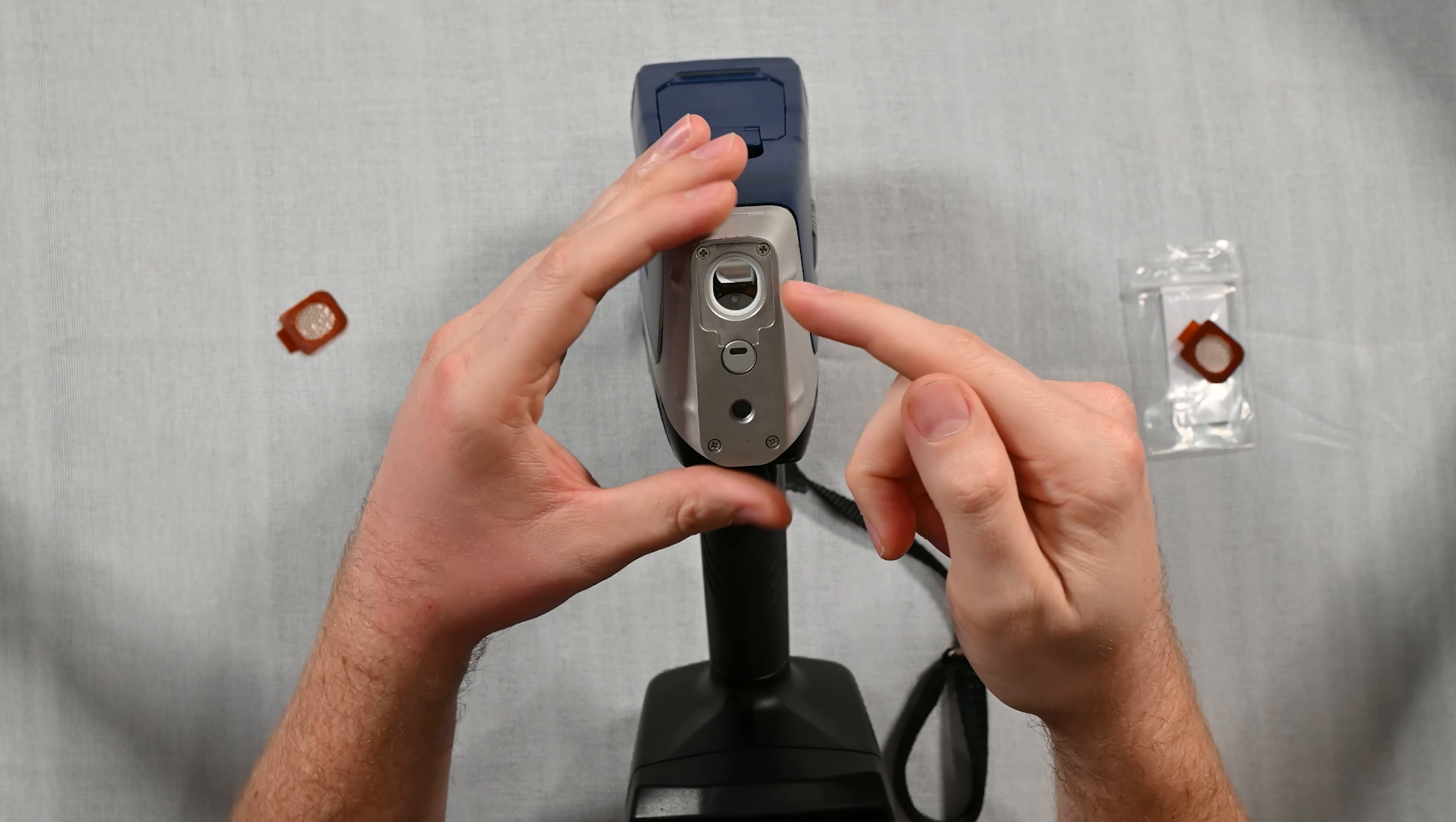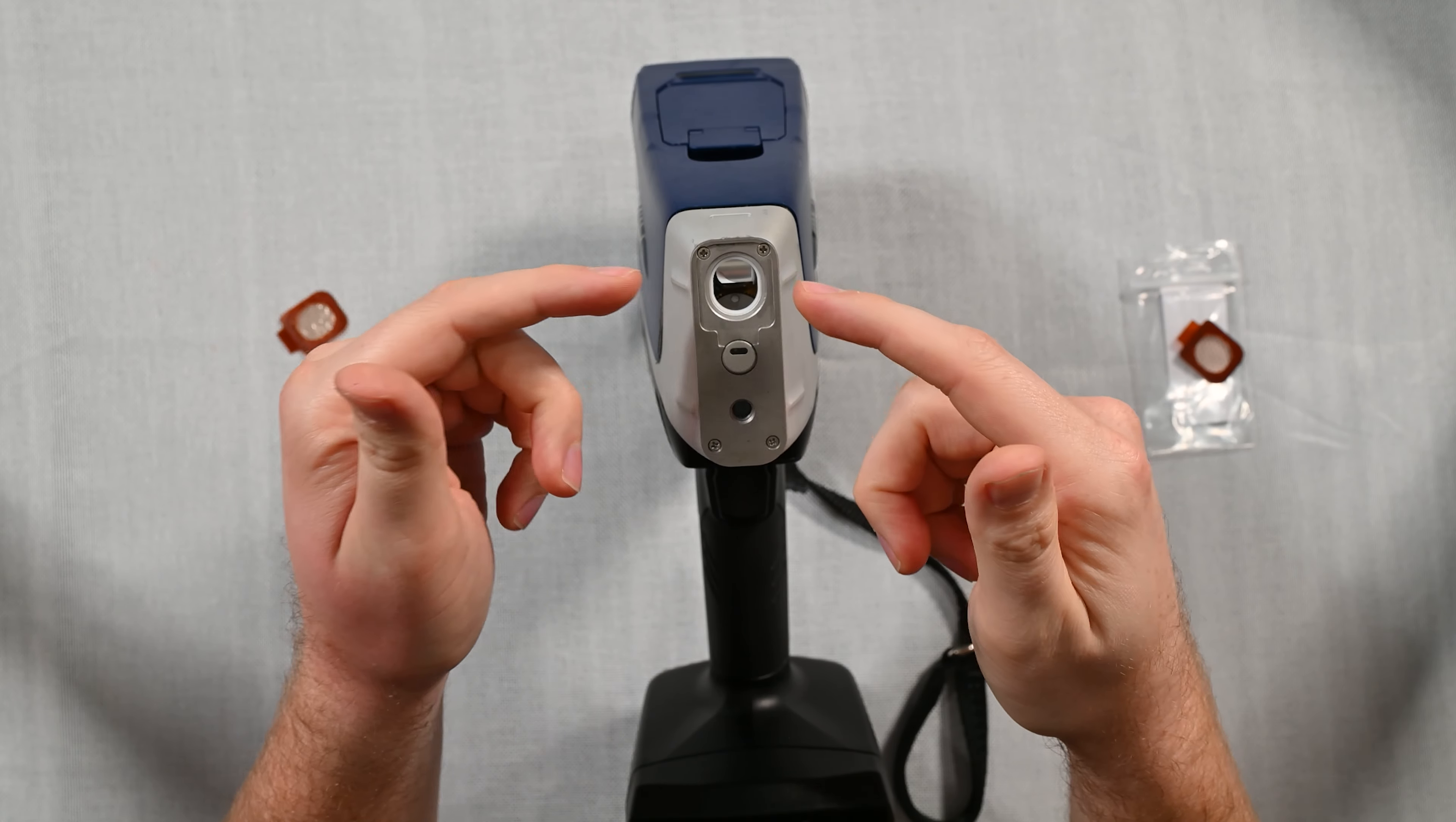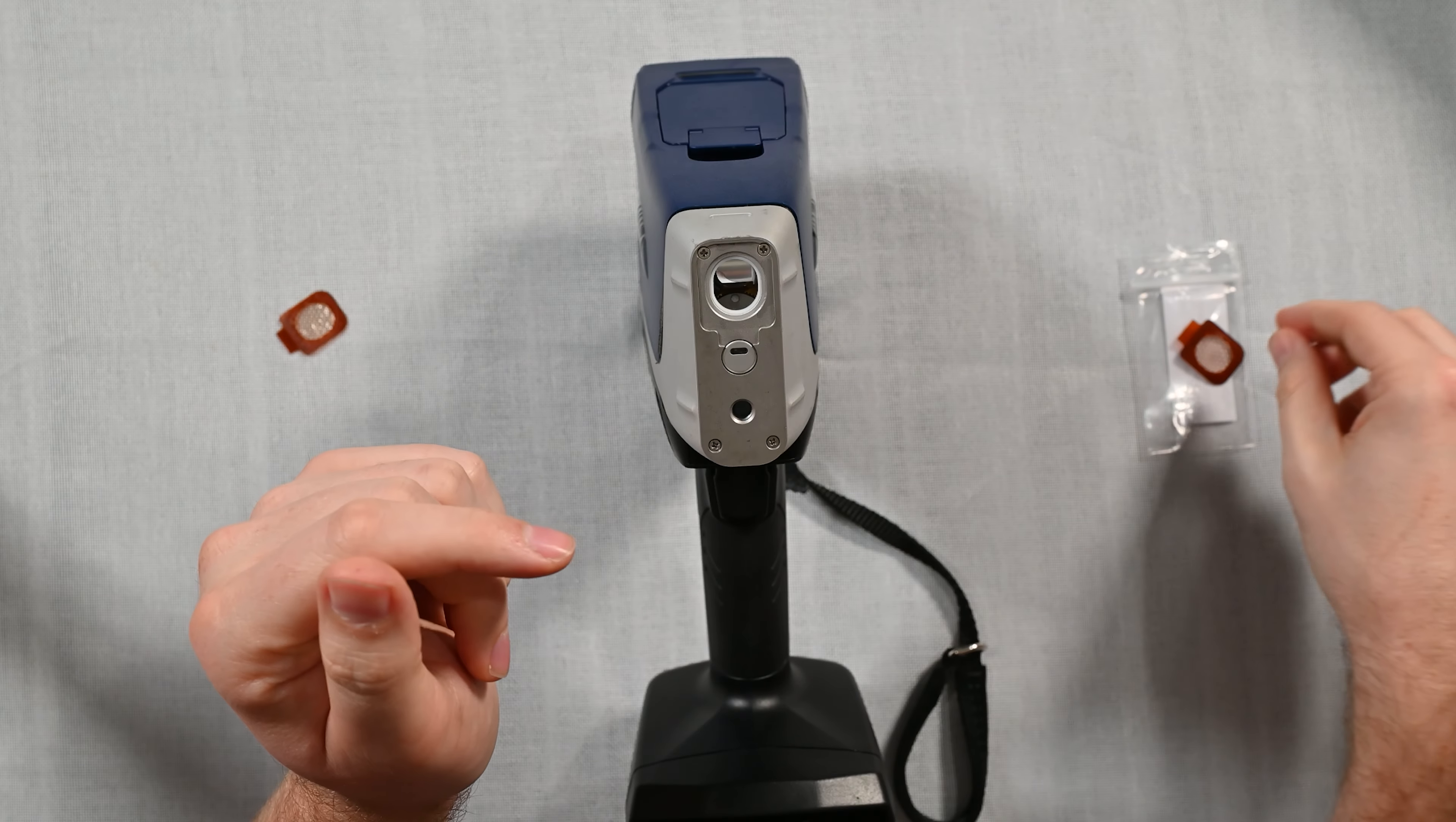You don't ever want to use compressed air or a Q-tip or anything like that to clean inside. You'll actually puncture the detector with something as little as a Q-tip. So just keep that in mind that you don't touch anything inside the nose of your analyzer.